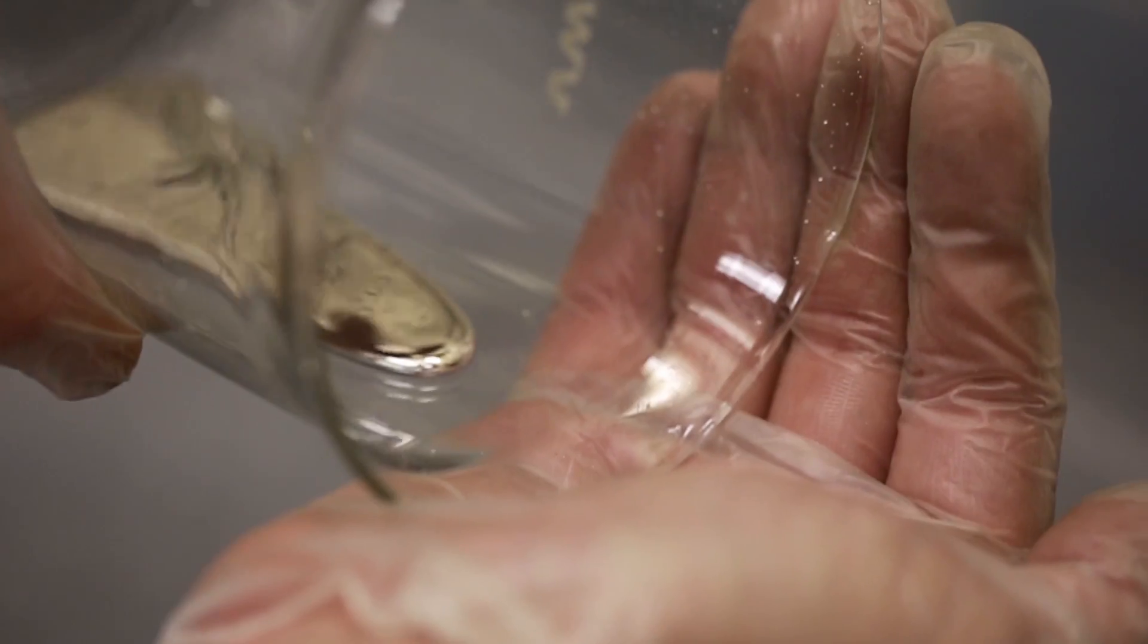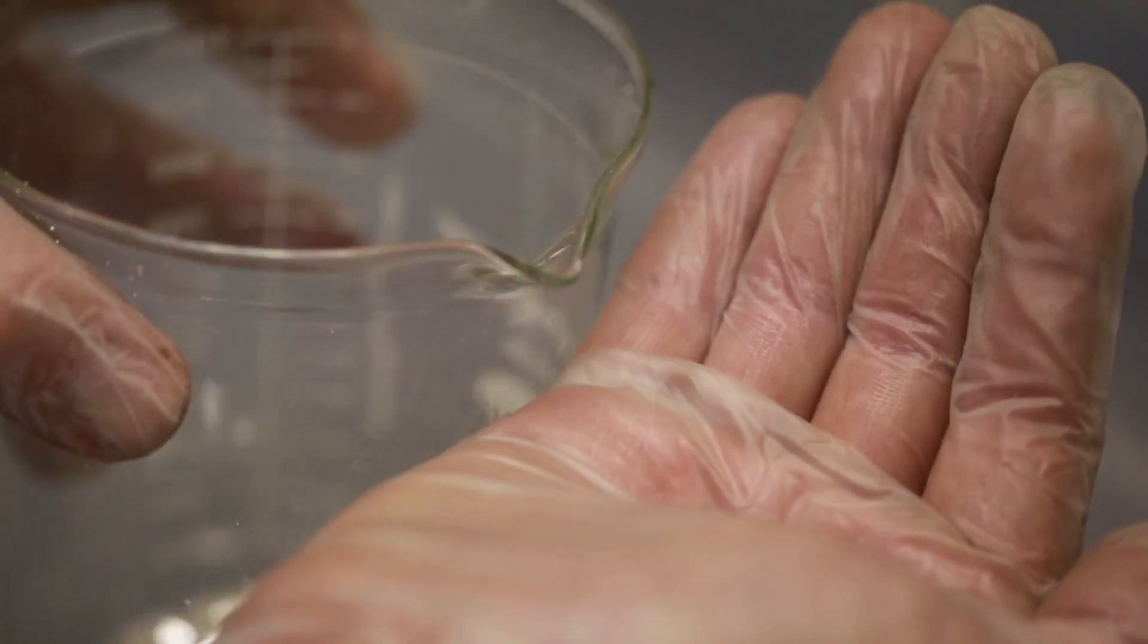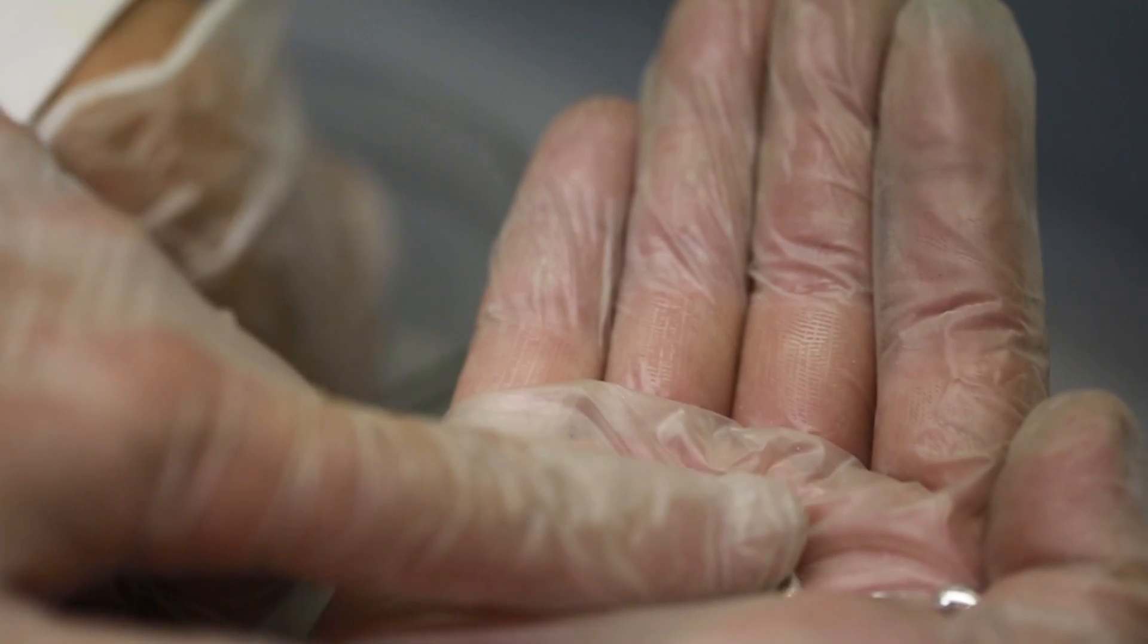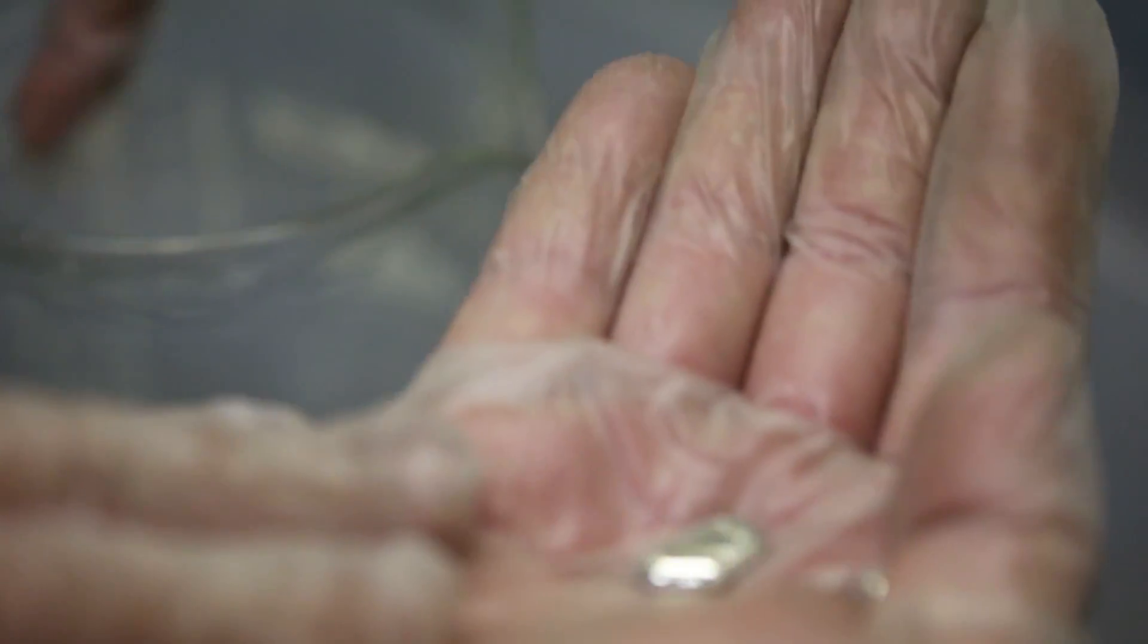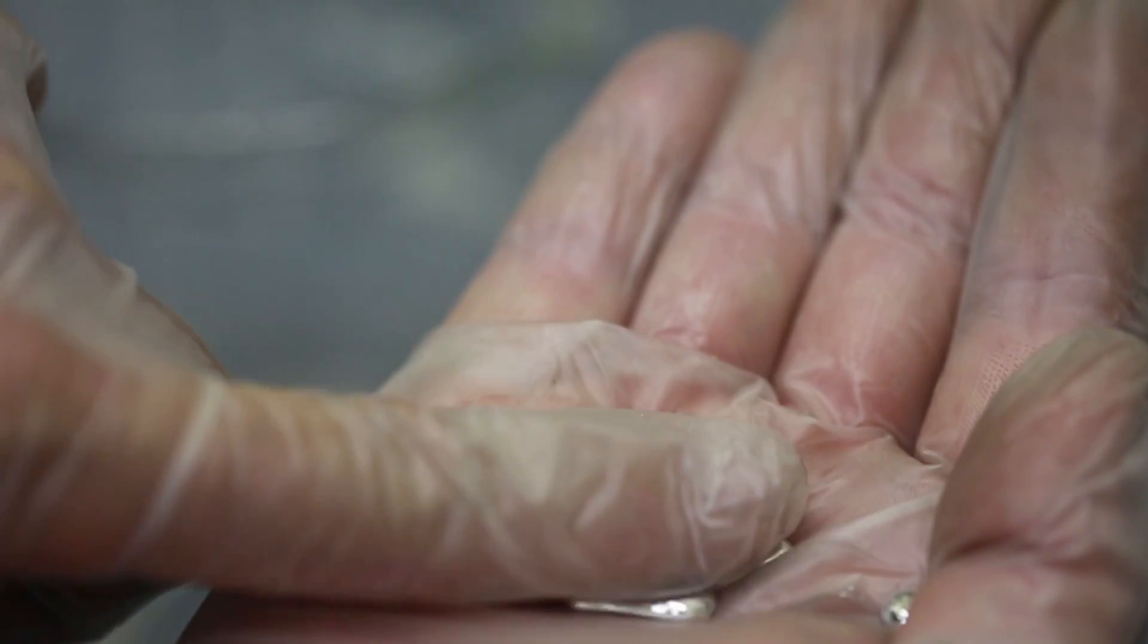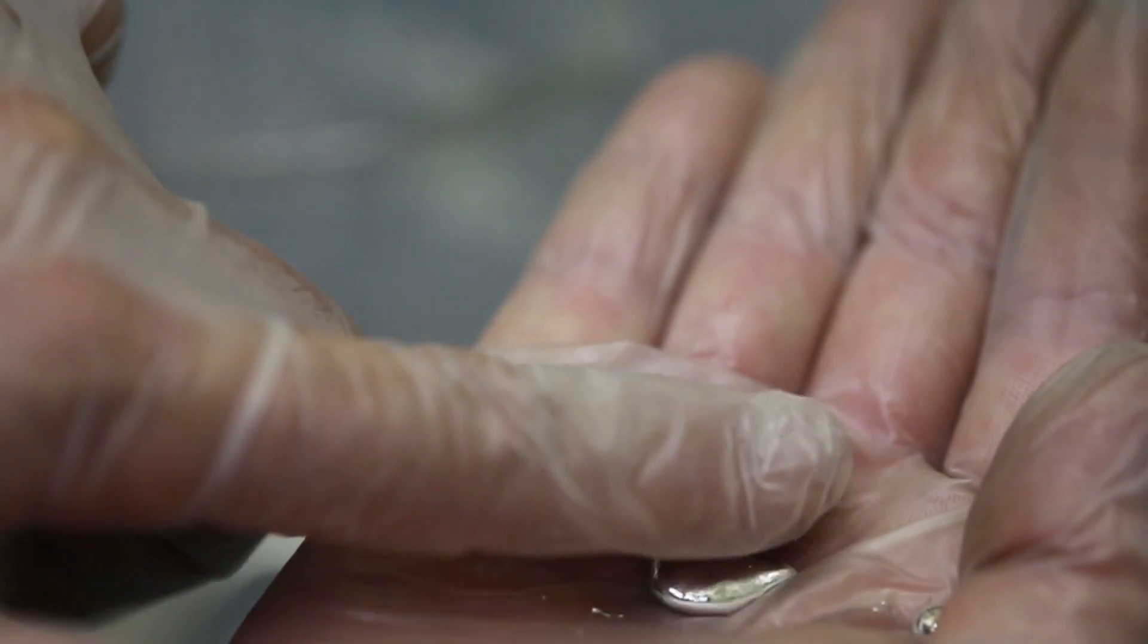Yeah, so that'll be good. Even Neil used to play with this stuff when he was a kid. There it is. It feels totally weird too. It's really amazing stuff, and you can feel the density of it. Lower your hand a little bit. Yeah, oh wow. So there it is. It just loves beading back up with itself. Even if you break it up into these smaller beads, just move it around a little bit and it'll just come right back together again.